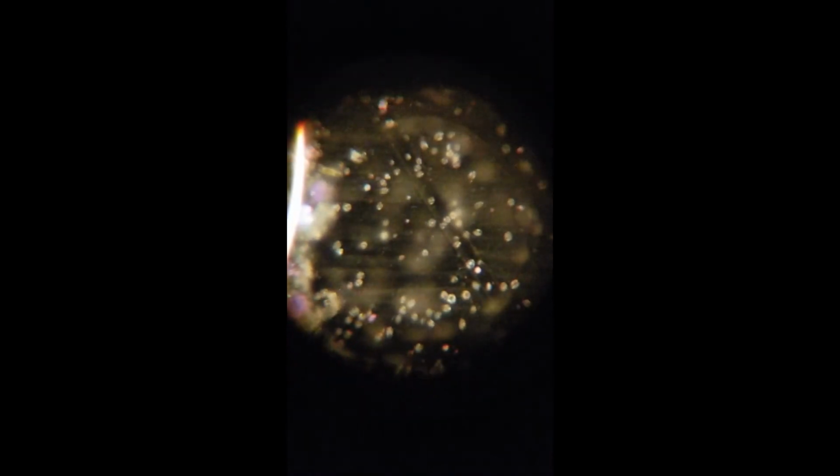Here's an expanding air bubble, pushing a whole heap of them, like a heap of leaves, right over. Many are dead or dying, and they're all getting swept away as this bubble comes.